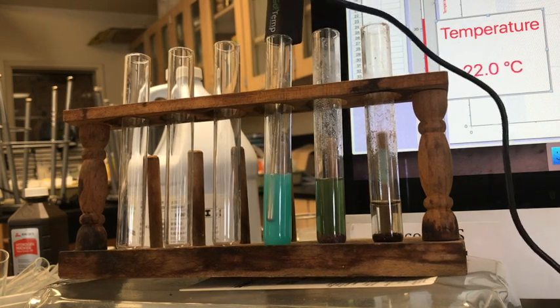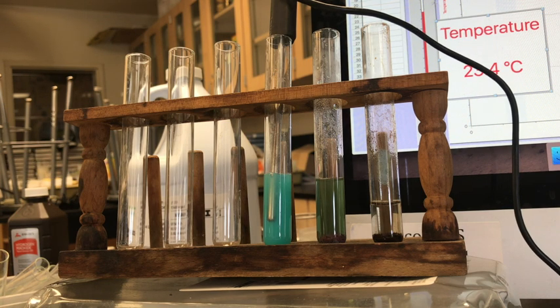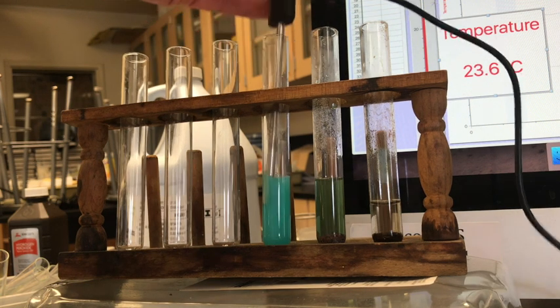Because all our observations are about change. So, what did we start with? What did we end with? And what we're trying to figure out is what is the change that's occurring during the reaction. Actually, it looks like the temperature went, maybe not. I'm not sure I'd say the temperature went down. Looks like it's pretty much the same. All right, let's add the acid.